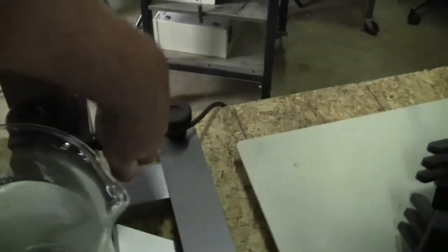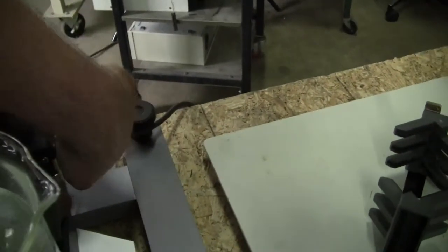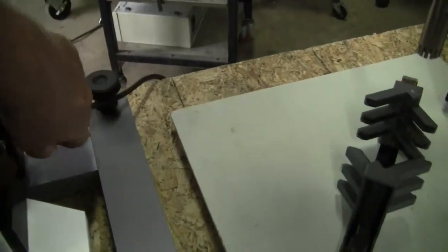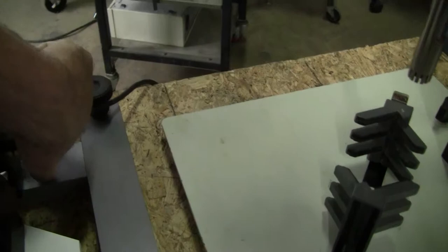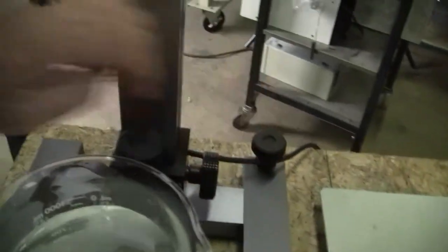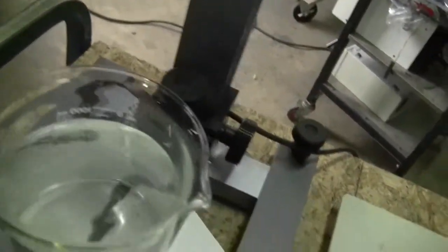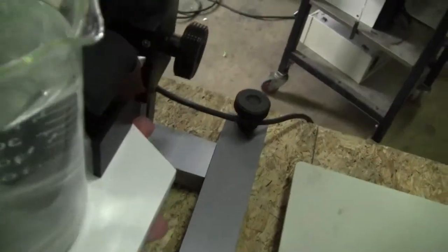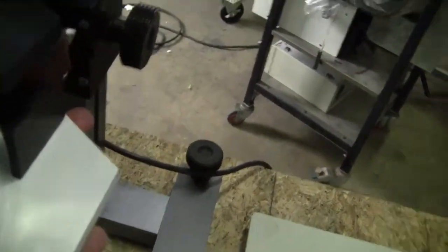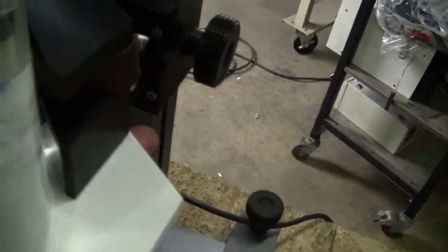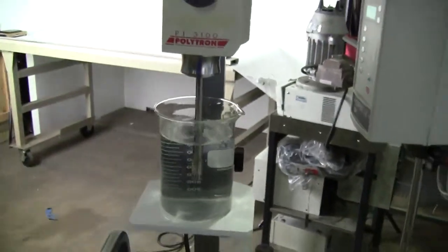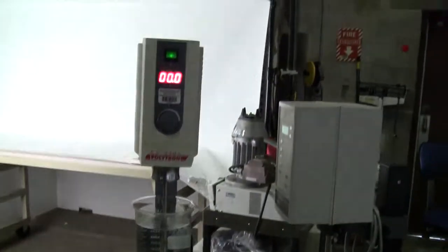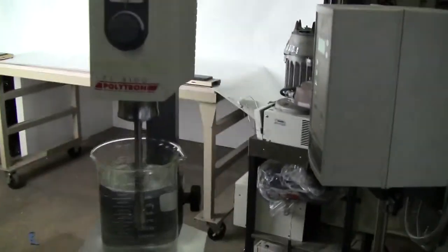Let's see if I can raise the sample up a little bit so we can get it going. It's going to be hard to do with one hand. Okay, that's in there. Sorry about that, but now we can take a look and see it run.